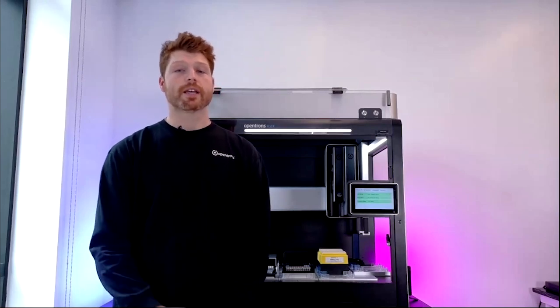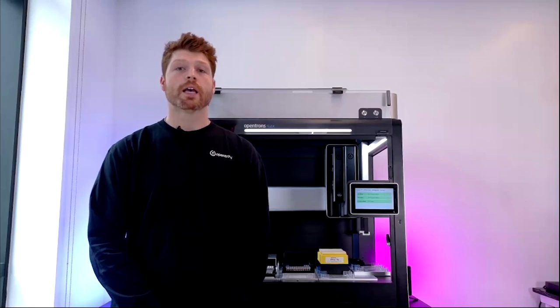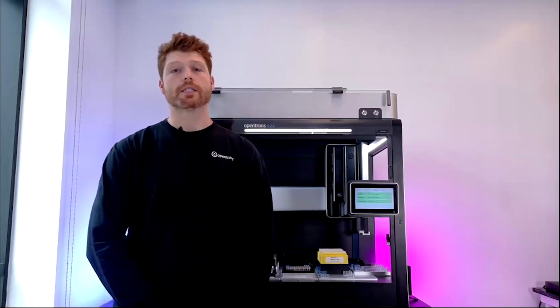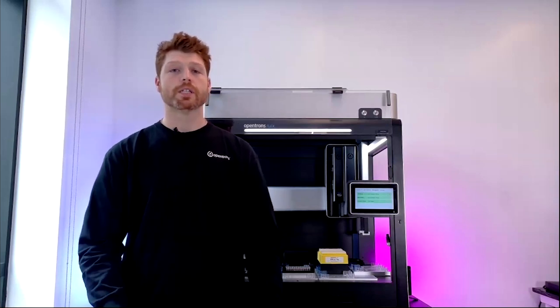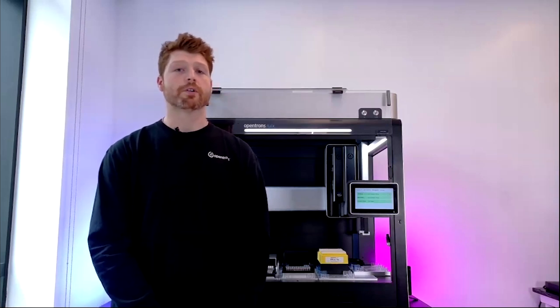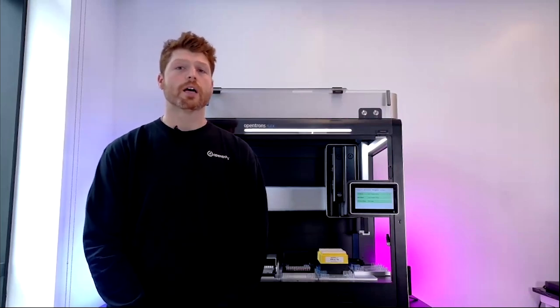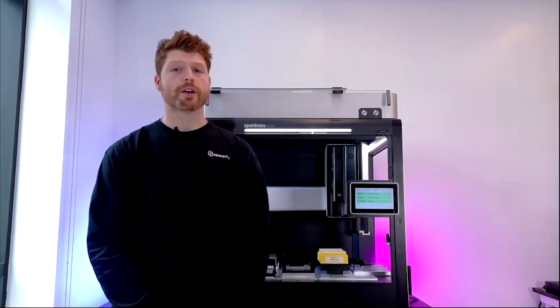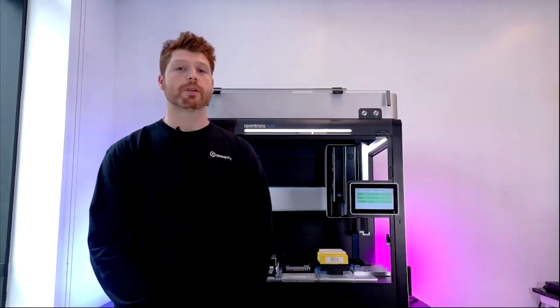First, we will need to navigate to the protocol library. You can do this through our website, and there you can browse the extensive collection of protocols. Opentrons really is trying to simplify the complexity of these procedures and ensure accuracy and reproducibility for your lab space and the other lab spaces that we are reaching. Additionally, we have a number of verified protocols that our in-house science team or the relevant kit manufacturers have tested, which are then given to you.